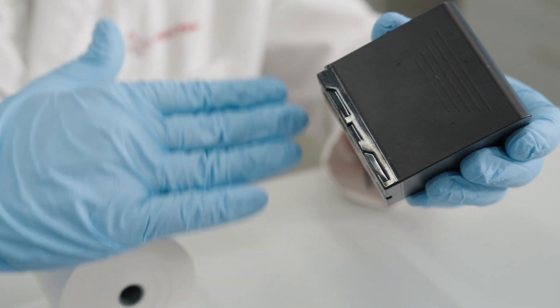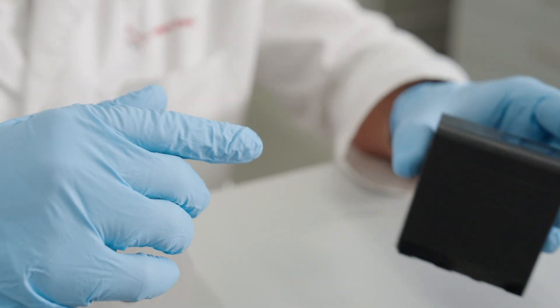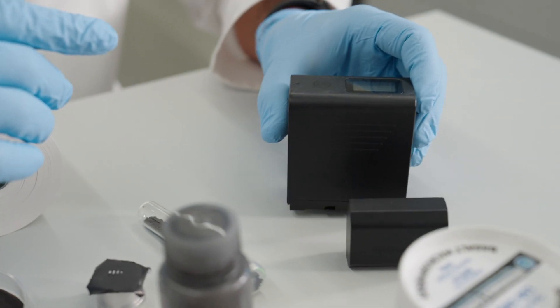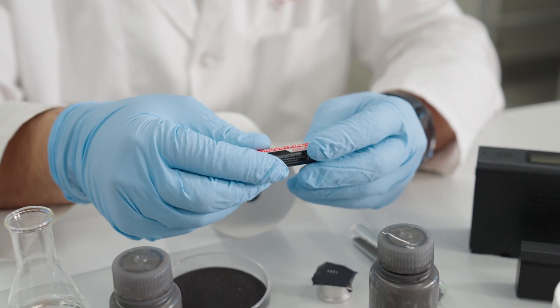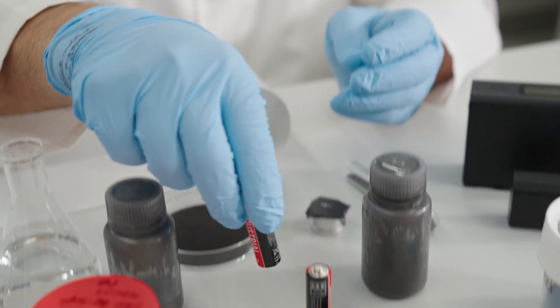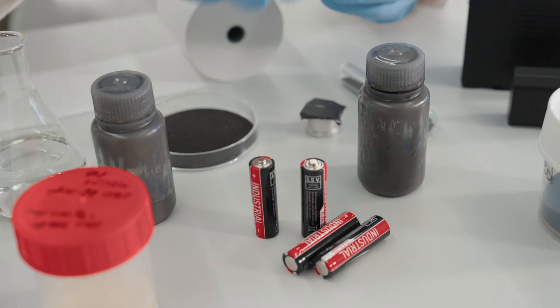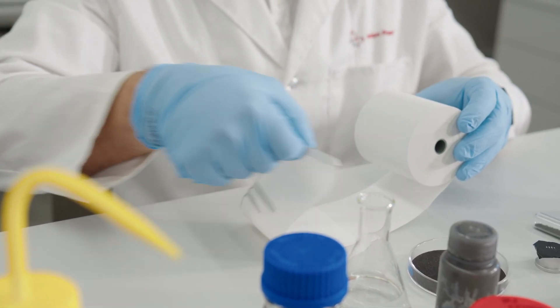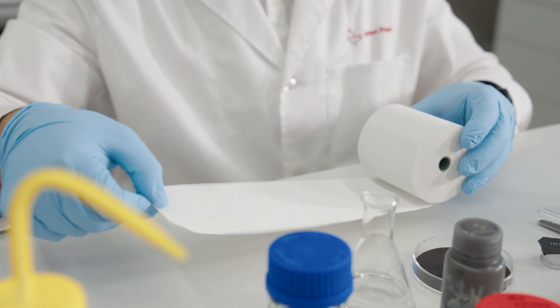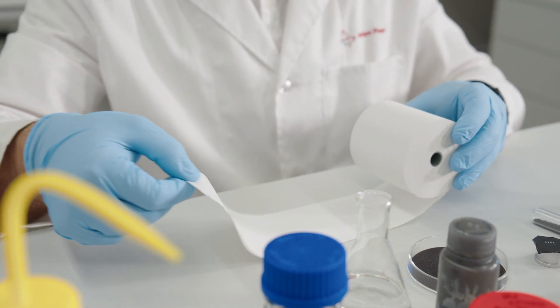At various stages of lithium-ion battery production, separators and current collectors undergo significant tension and torsion forces that can potentially stretch or tear the materials. A dynamic mechanical analyzer, or DMA for short, can be used to measure the structural properties of these materials and indicate the forces that they can withstand before breaking or tearing.